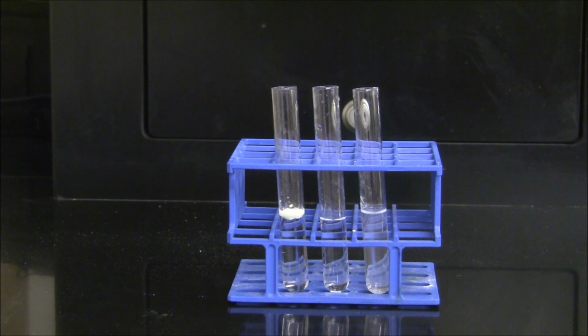In your data table, write down the observations of the 3 substances with the hydrochloric acid. Then, for the gaseous product observation, indicate what the identity is of the gases that were produced when the hydrochloric acid reacted with zinc and when the hydrochloric acid reacted with the product. Then give the chemical formula of the 2 gases in those 2 reactions that occurred with the hydrochloric acid.